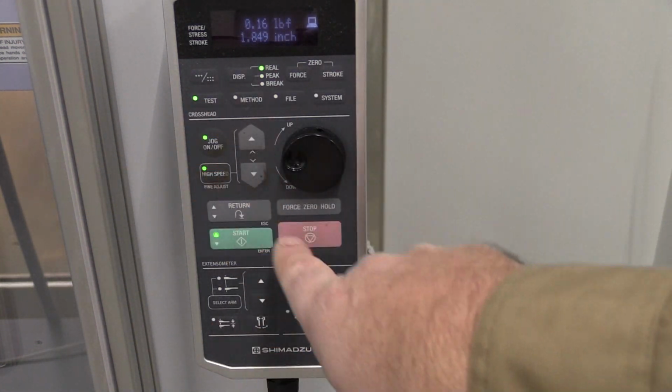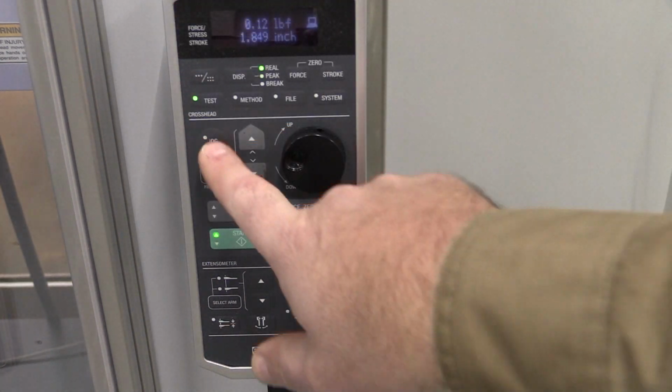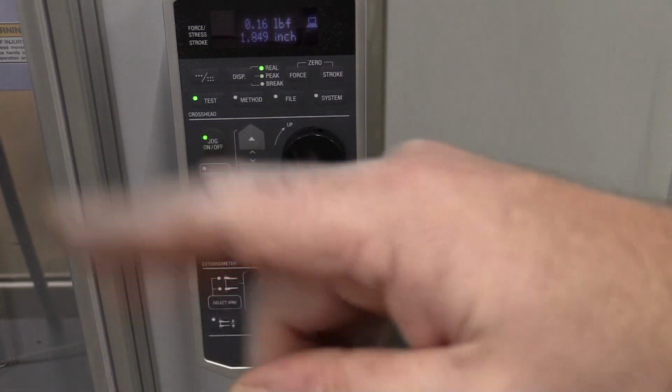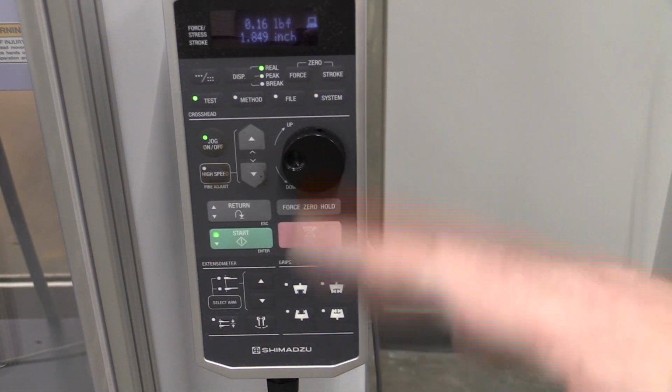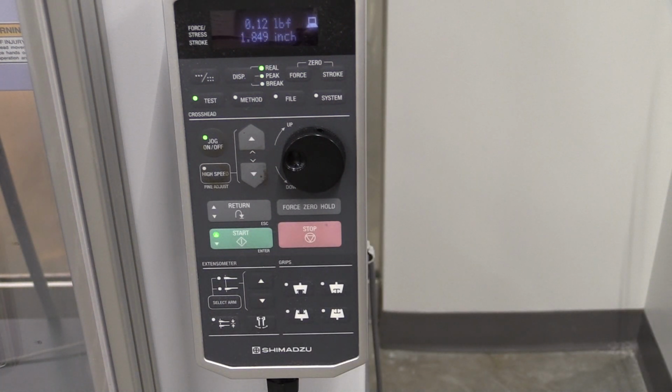When we're done adjusting the machine, we need to come in here and hit stop, so then we can conduct a test. If we're in jog mode, it'll say on the controller over there, when we try and run the test, that there's an error that you're in manual mode, and that means that we have the jog button pressed. So once we have that done, I'm going to take that off, and let's go load our sample.